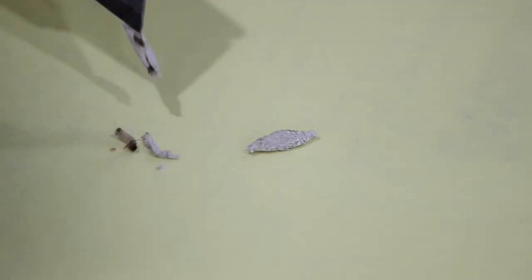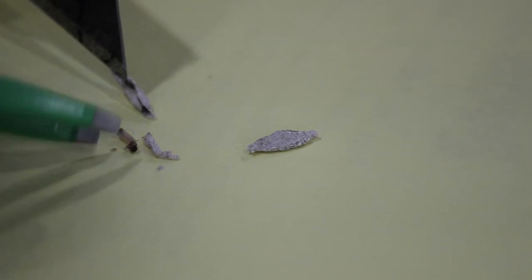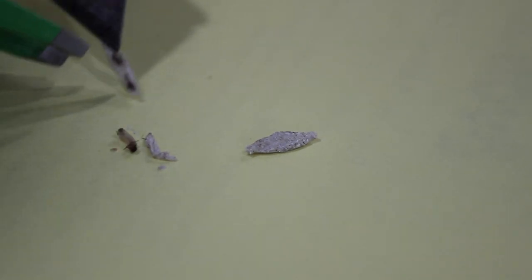Dissecting. Oh, you're dissecting it? There's the larva. You see the larva? Okay, don't get in front of the camera. Oh my gosh!